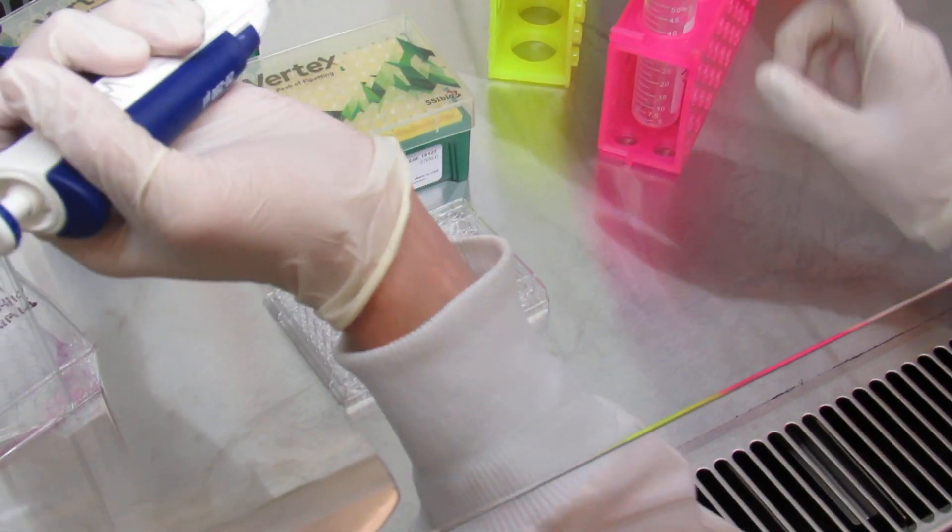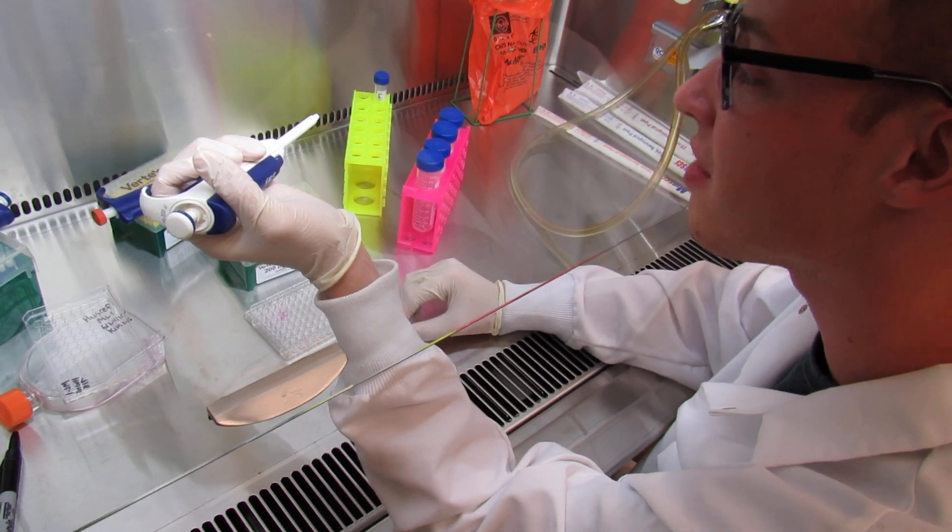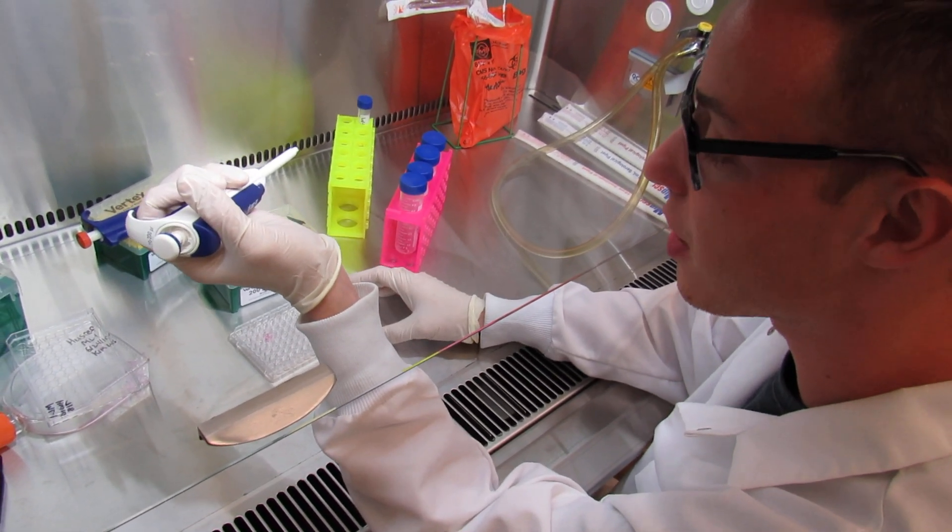Because you're using all the same media, you don't have to switch tips in between. You are able to use the same tip for all of them unless you encounter a problem with that tip.